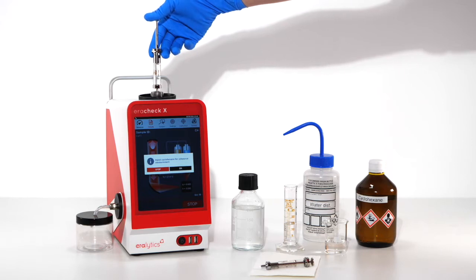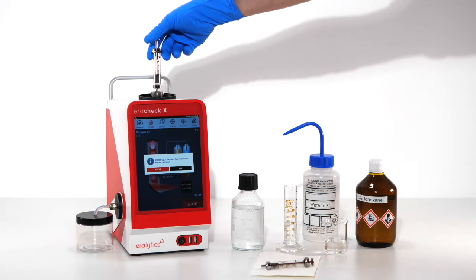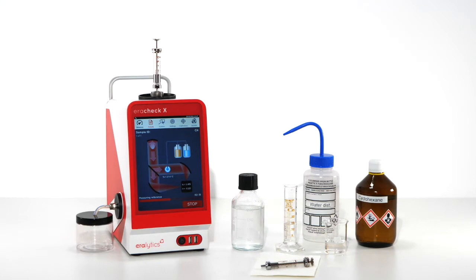Inject 5 ml of cyclohexane and click OK. Wait until the reference measurement is completed.